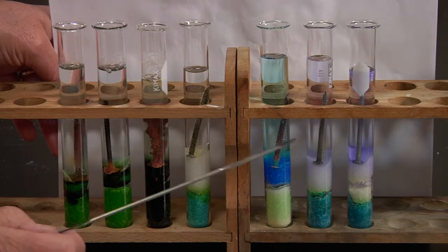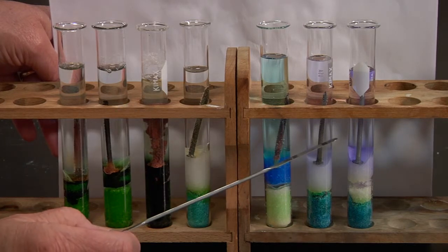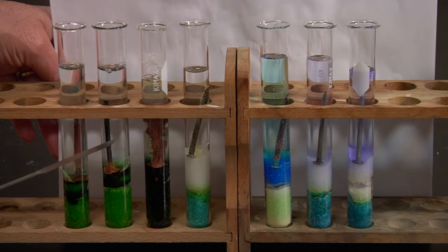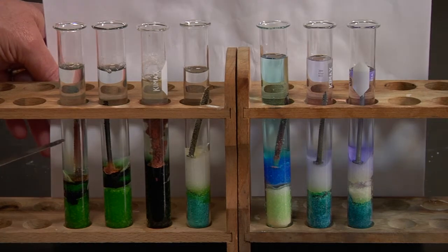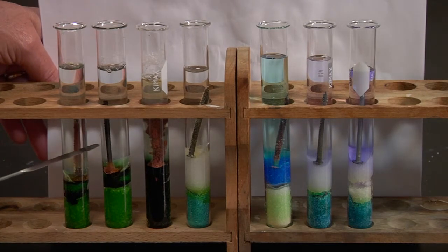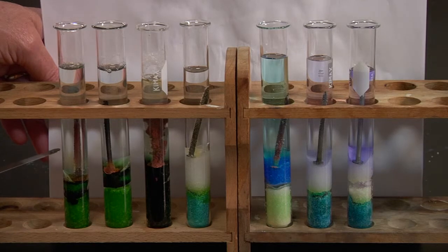This one looks more blue. That one looks a little bit more purple. The solutions over here seem to be almost clear.